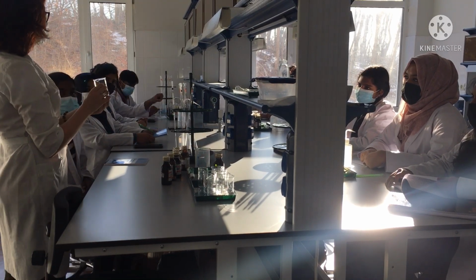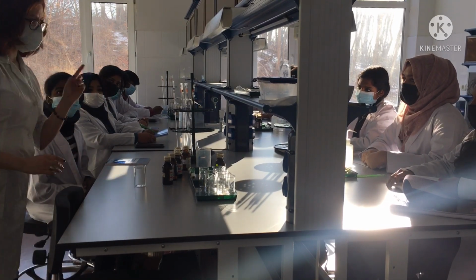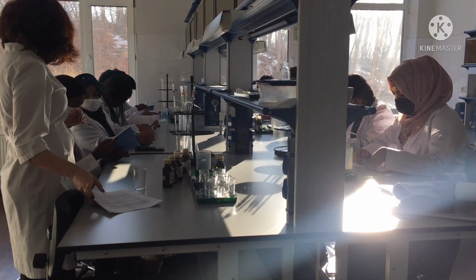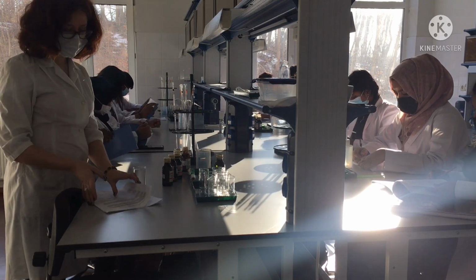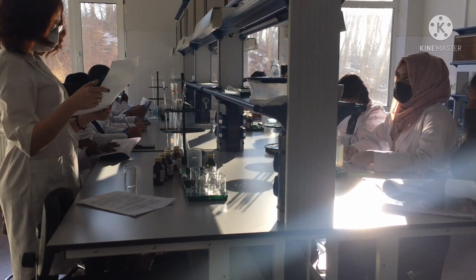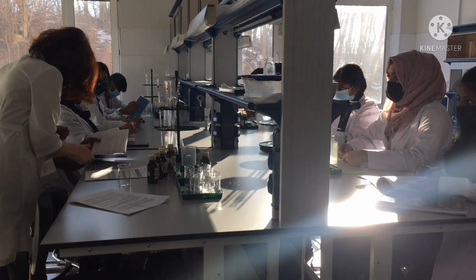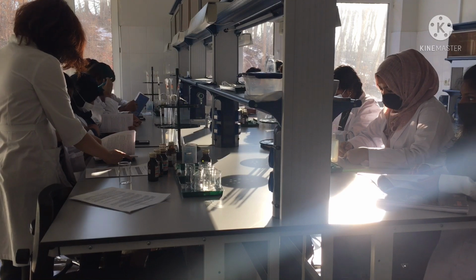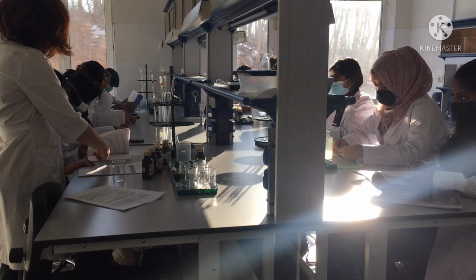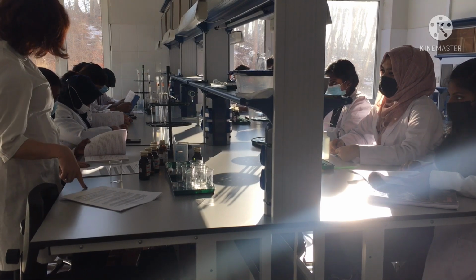Here you will see the beakers with numbers. These are the numbers of the trials for the A series, as you can see in your manuals. We have 7 trials, from A1 to A7. Open it, please. So in table A, we will see the experiments A1 through A7, and here you will see the variety of different amounts of reagents. This is the volume in milliliters. And in this part you will need to write down the time to reaction.